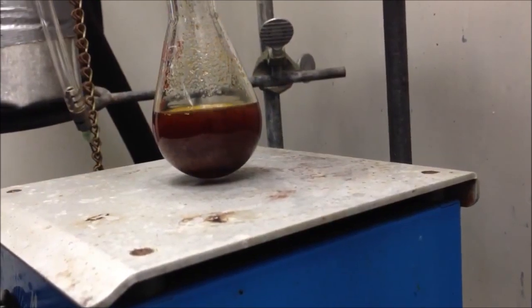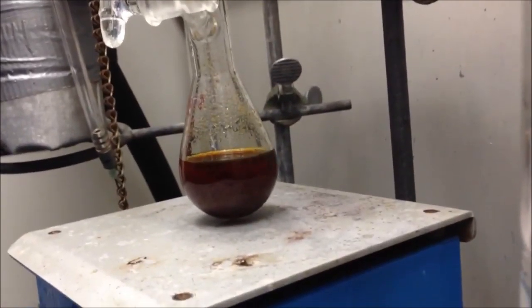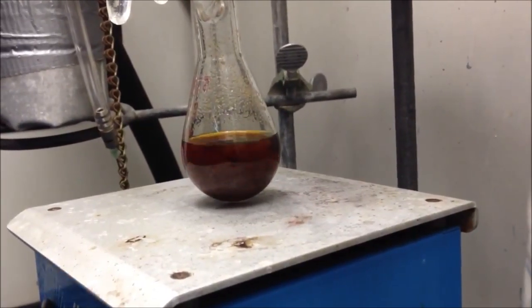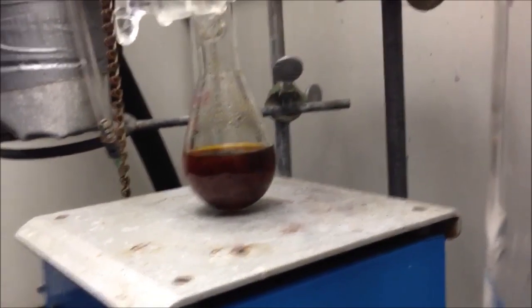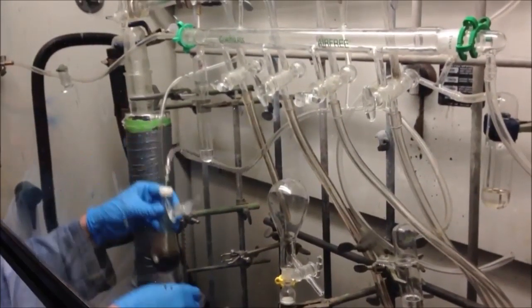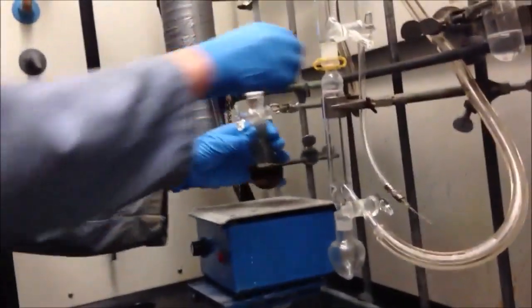Looking pretty good in there. And we just want to make sure this is at room temperature, so that most of the solids are not soluble. And I can see how we've got a good amount of product in there. Now the challenge will be getting it out of there without screwing up. Okay. So I think we're ready for the filtration. So I'm going to remove the nitrogen needle. And clamp it.